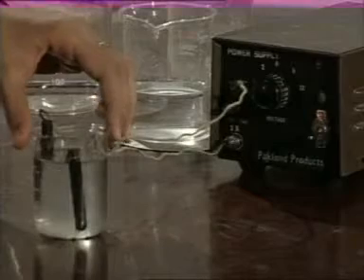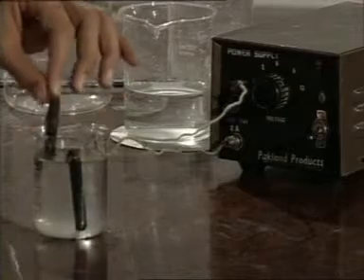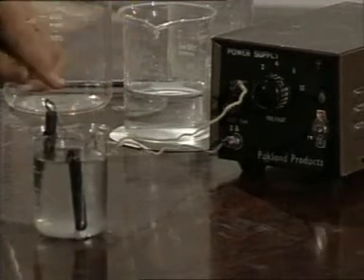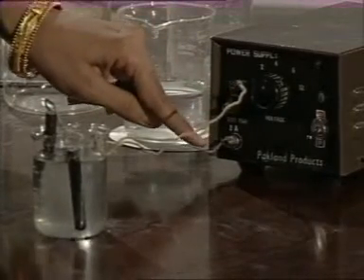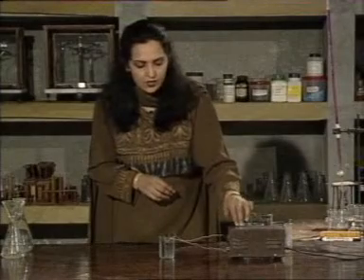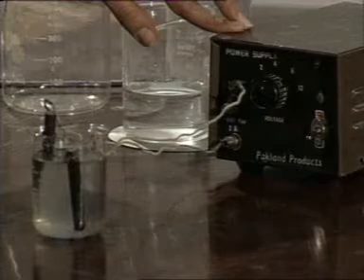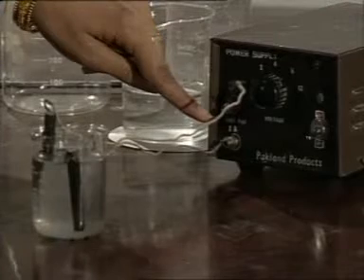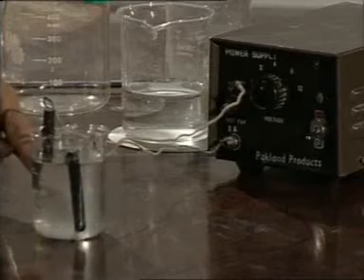The apparatus which we use for this purpose consists of a container. We have a beaker here, and 2 inert electrodes. These are of graphite, with wires which are connected to the respective terminals of the battery, a source of electric potential. We have a source of direct current here. When these wires are connected to the respective terminals of the battery, the reaction starts and the solution becomes basic in nature.